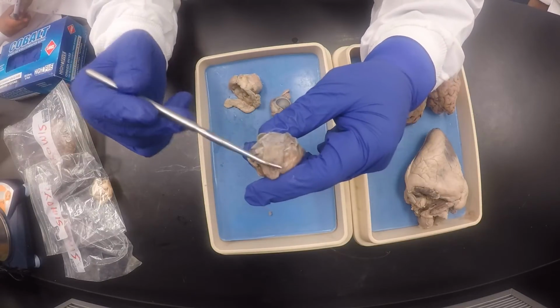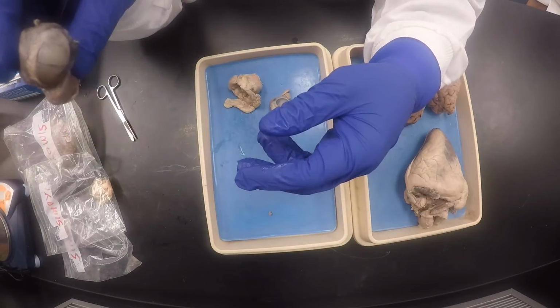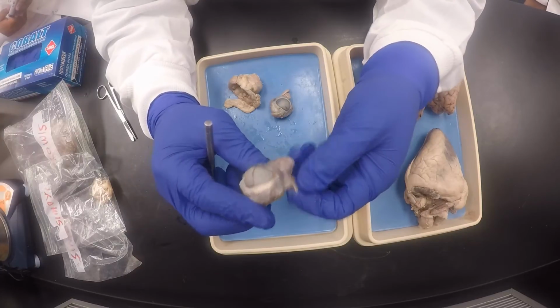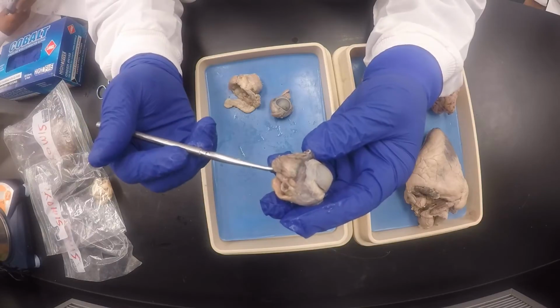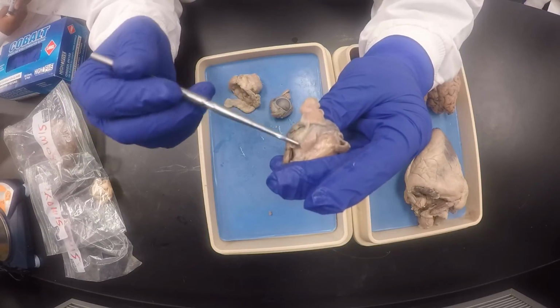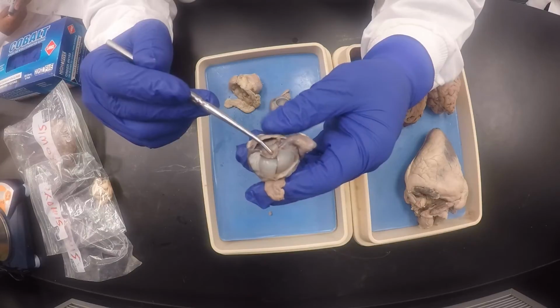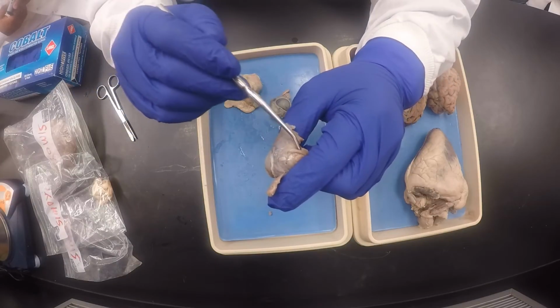Therefore this is the eye on the right side, because this is the lateral side. This goes, and this is the nose bridge. So therefore this is the medial rectus. So medial rectus, superior rectus, superior oblique, inferior rectus, inferior oblique, lateral rectus.